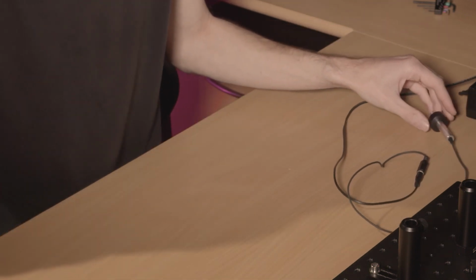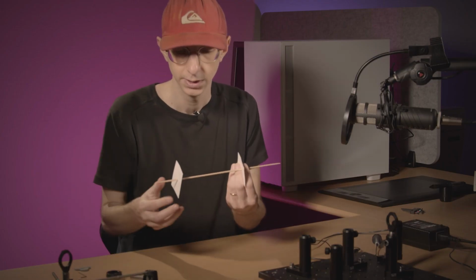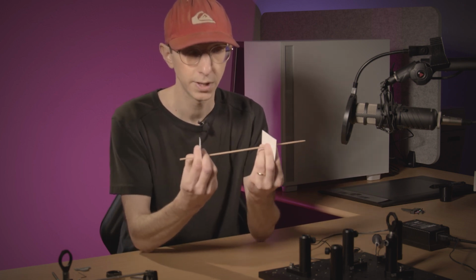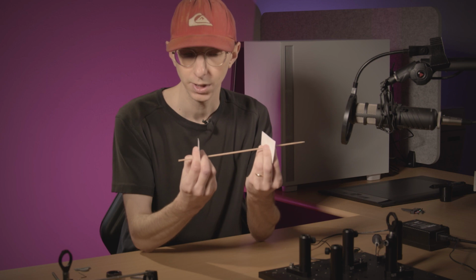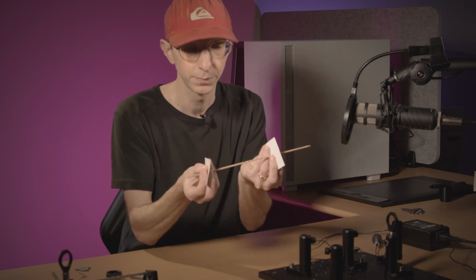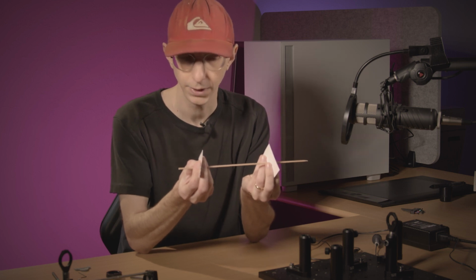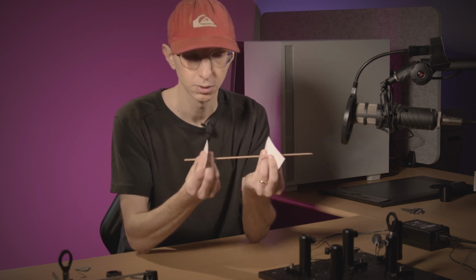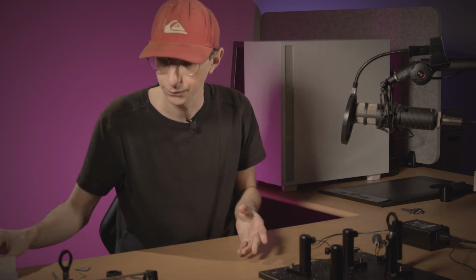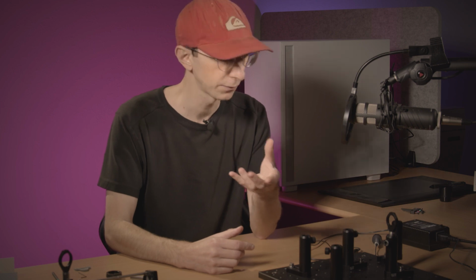I will take back the barbecue skewer so that you can see it. You can move the first aperture up and down, left and right, and move the second aperture up and down and left and right. And we saw that the other degree of freedom, the rotation, has no effect, such as getting the two apertures closer together has no effect as well. So we have 4 degrees of freedom, and you can do anything you want as long as you have these 4 degrees of freedom to align your laser.